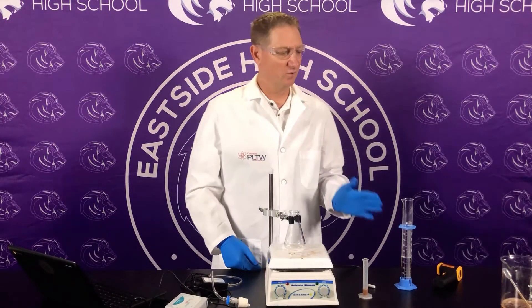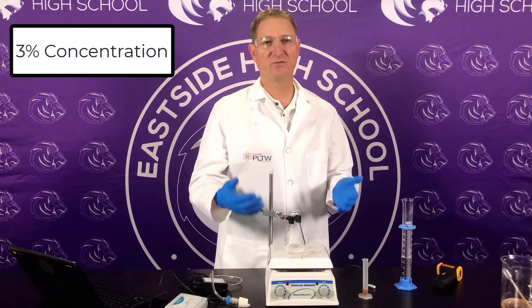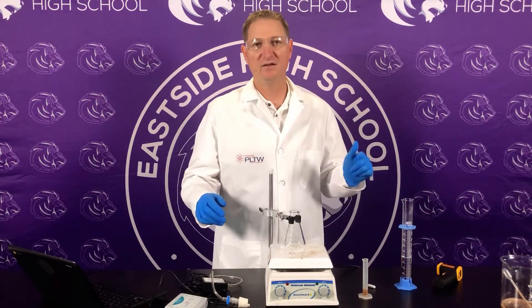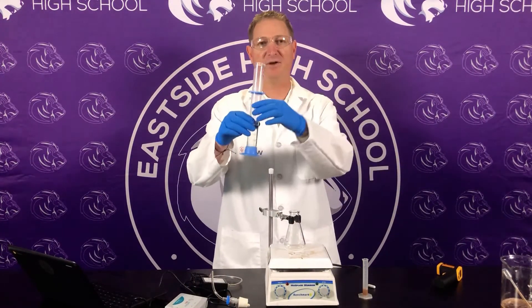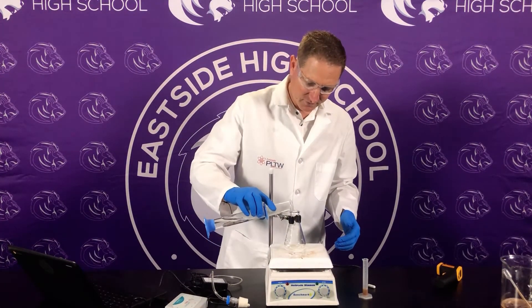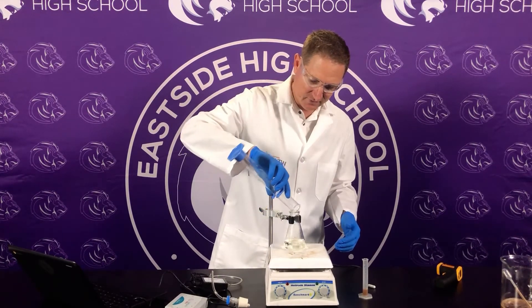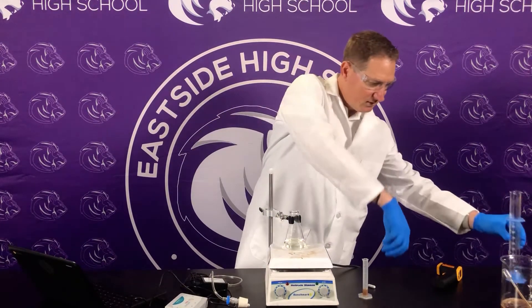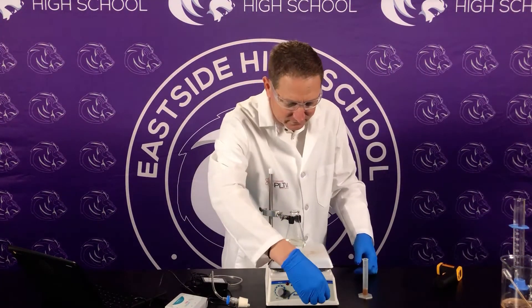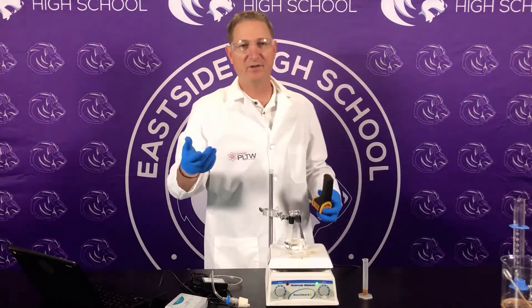Now we're going to do the warm H₂O₂. It's important to note that this hydrogen peroxide is 3% just like the baseline — everything else is consistent except for the temperature of the H₂O₂. I warmed it up in a water bath for consistency. I'm going to pour this 50 ml of warm H₂O₂ in, put the stir bar in, take it to five, and then take a temperature.